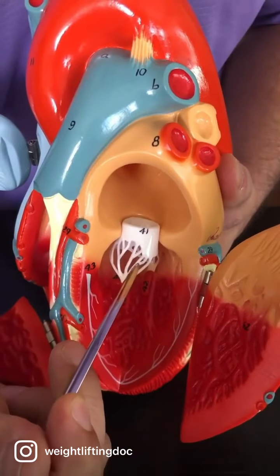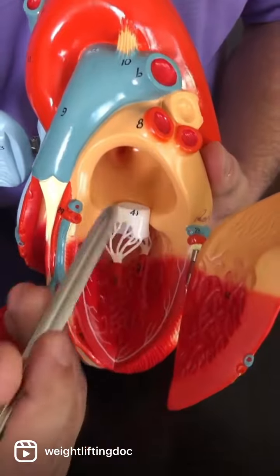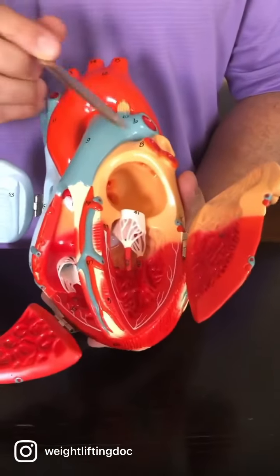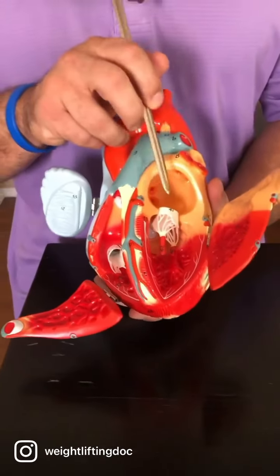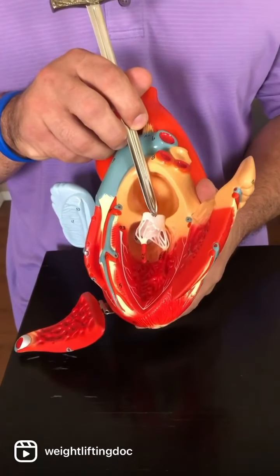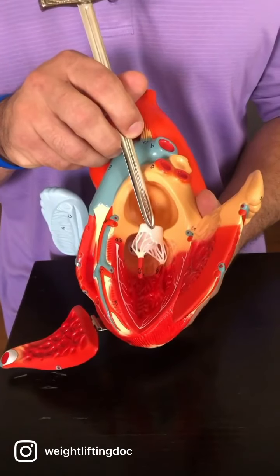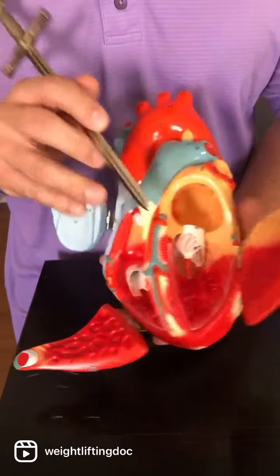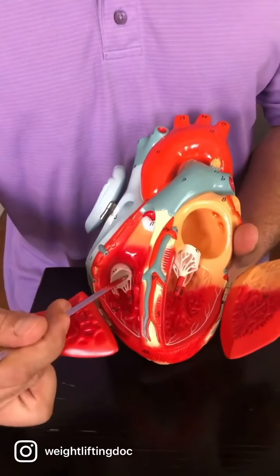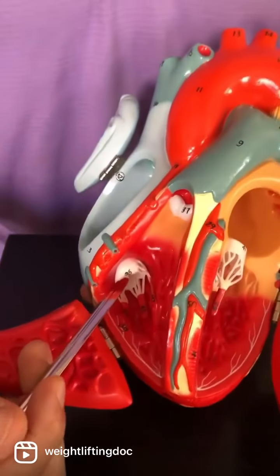They're called chordae tendineae. And then they attach to the AV valves, which on a test, you're not going to call AV valves. You're going to give them their appropriate names. So we're going to name those. And then I'm going to show you some more stuff on a smaller heart at the very end of this video. This one right here, on the left side, is called the bicuspid, but it also has another name. It's also the mitral valve, so you could use either name on a test. If we go on the right side, this valve is called the tricuspid. Now make sure, if I'm on the cords, it's chordae tendineae. If I want the valve, the arrow will be right on the valve.